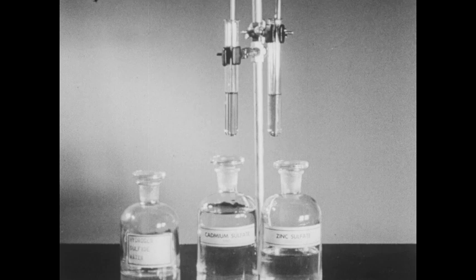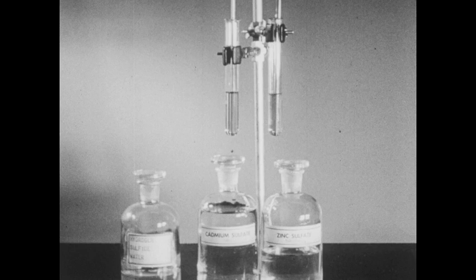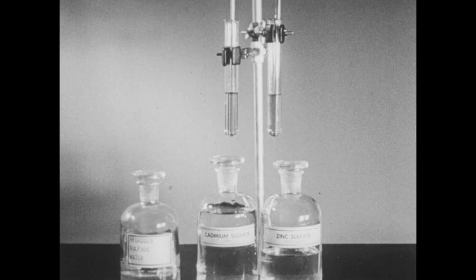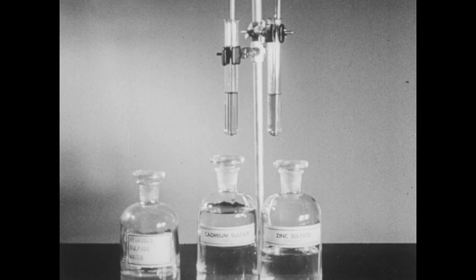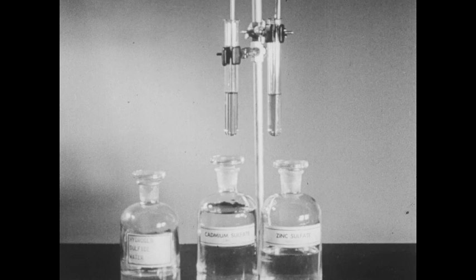In this experiment, we will examine solutions of cadmium sulfate and zinc sulfate again to see which of the sulfides of these two metals is the least soluble. In this tube I've placed some cadmium sulfate solution, and in this tube some zinc sulfate. To each tube I've added a drop of methyl violet indicator, which causes a purple color. Methyl violet is an indicator that is purple in solutions less acid than about three-tenths normal.